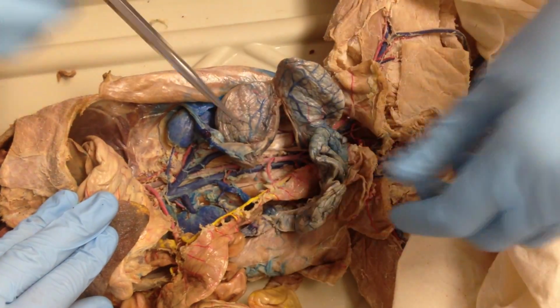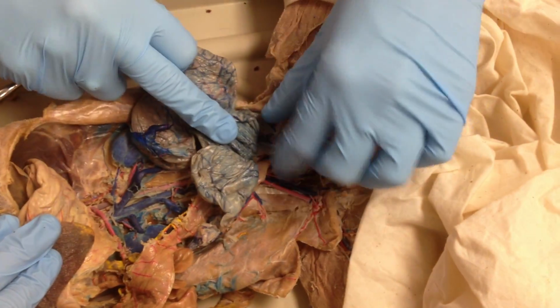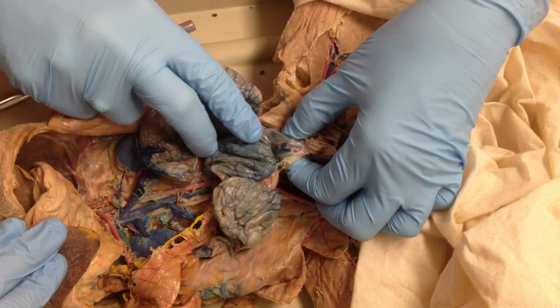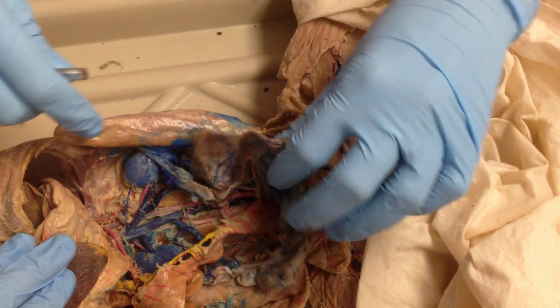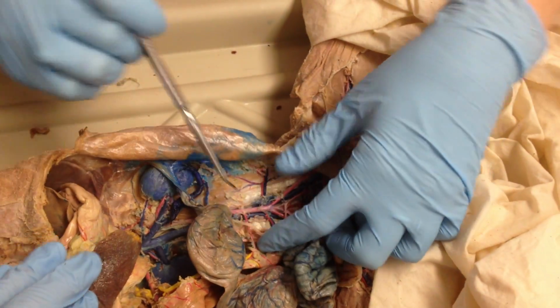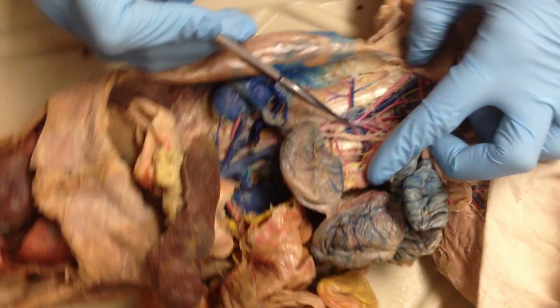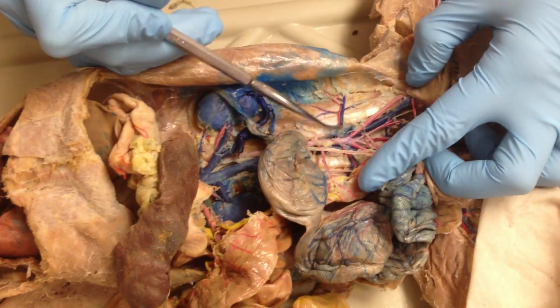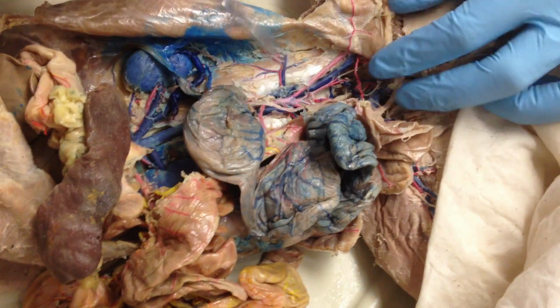So the uterus, these are the uterine horns, and then the body is down at the base of the Y. That's the body. The whole thing is the uterus. The uterine horns are cornu. Alright, down here at the bottom, your dorsal branch here. Once you get down towards the pelvis, we've got the iliolumbar, left and right, and artery and vein.